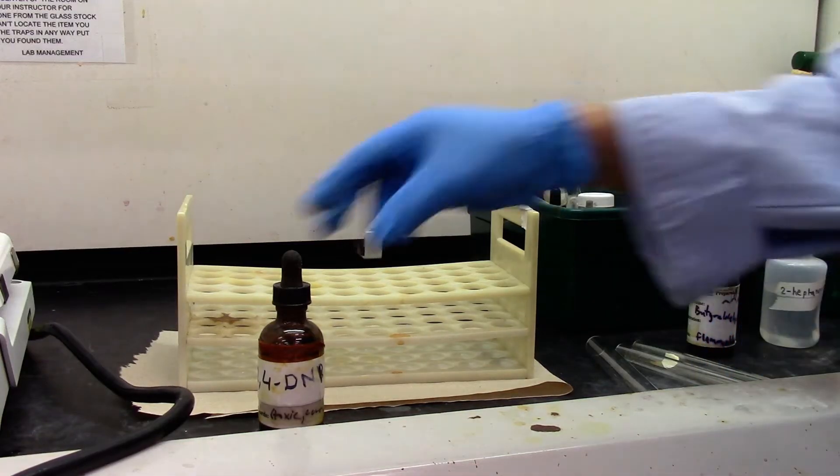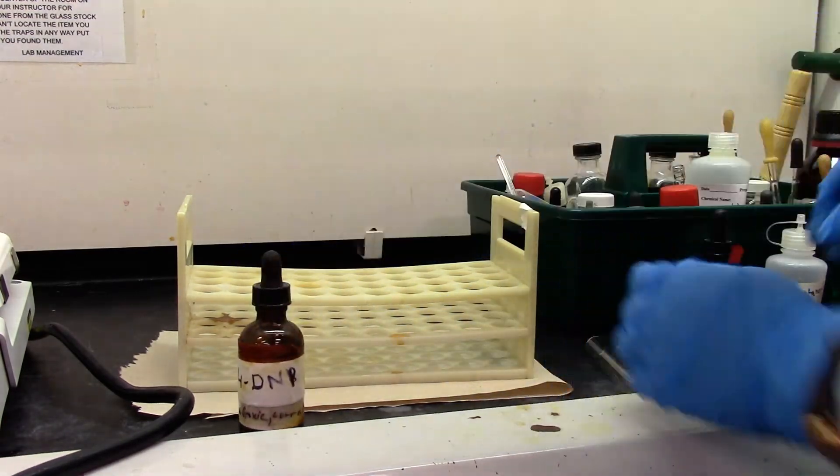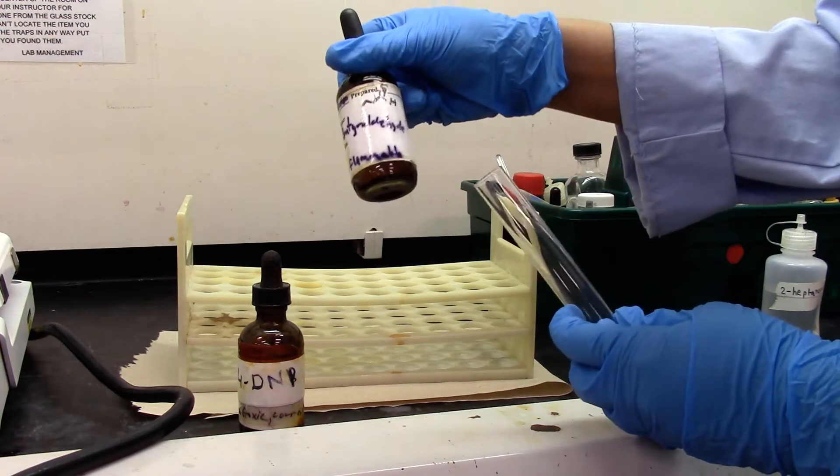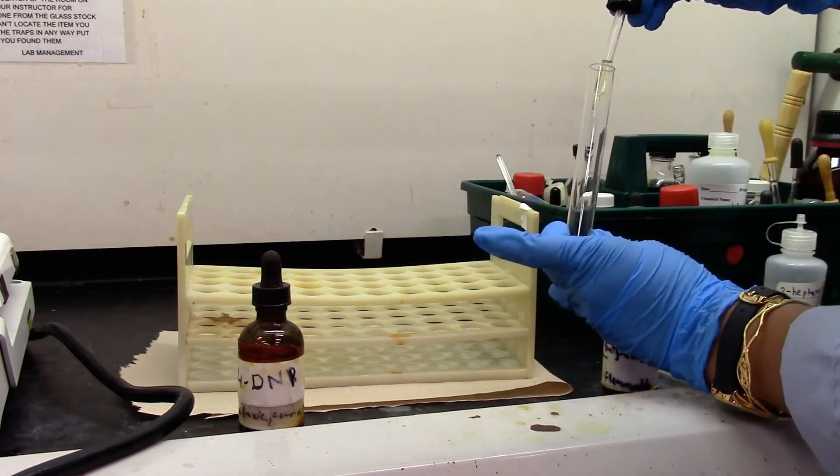We will be doing 2,4-DNP tests for aldehyde and ketone. I'm taking a couple drops of butyraldehyde as my aldehyde. Two drops, one, two.